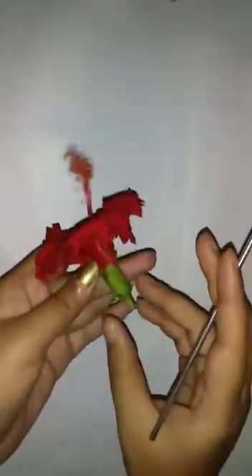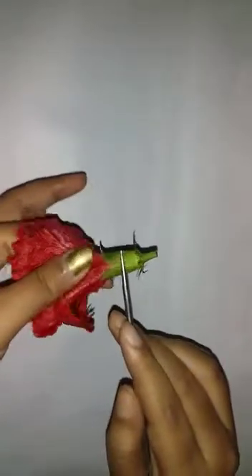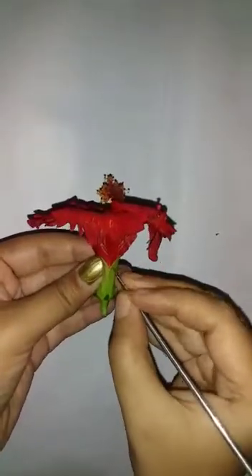Let's separate the various parts of this flower. This is the epicalyx. Above the epicalyx, this is the calyx. The sepals are joined with each other, so this is called the gamosepalous condition. The aestivation is valvate here. Now separate the calyx from the flower.